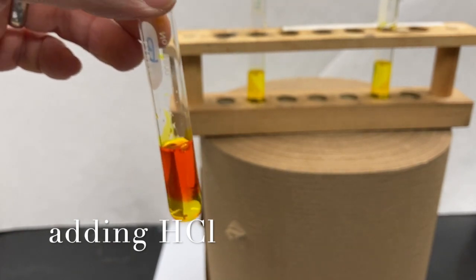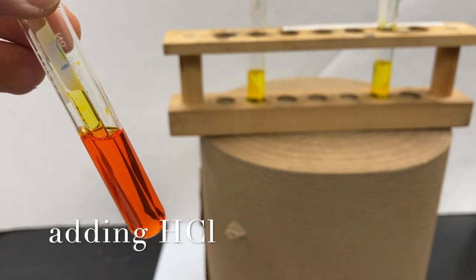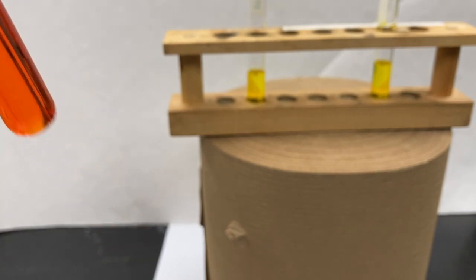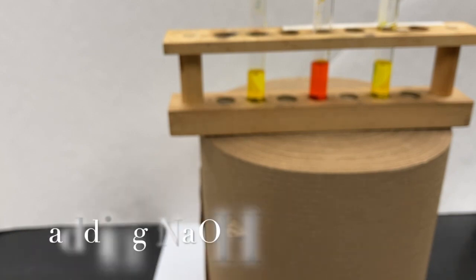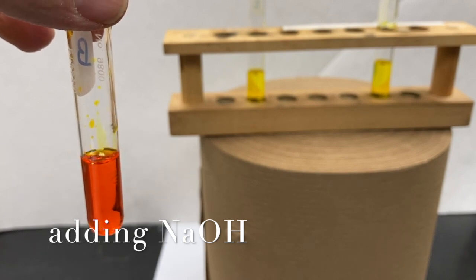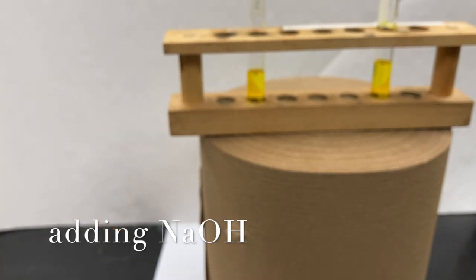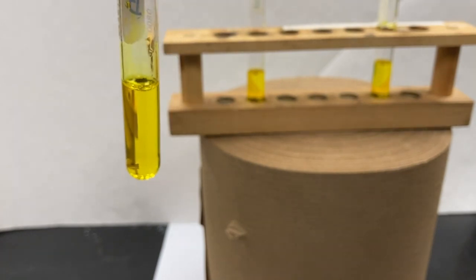We get a very neon orange color. So let's see what happens when we add sodium hydroxide, when we add a base. By adding the sodium hydroxide, we get a reversion back to our original color.